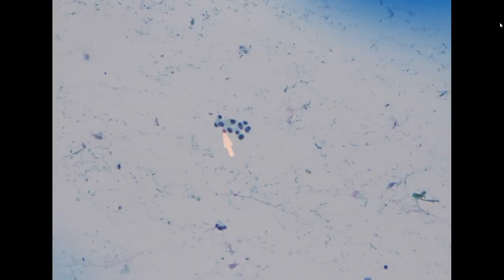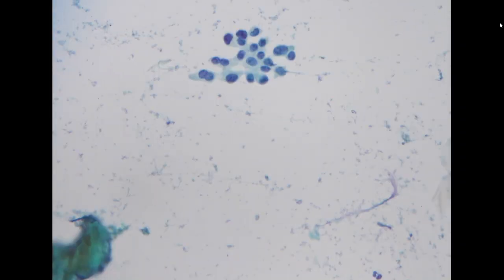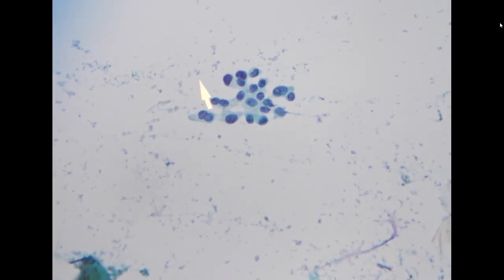So here again, we have hyperchromatic cells in a ductal arrangement. Here as well, ductal arrangement. And because this is not from primary breast, we won't be able to see the so-called myoepithelial cells because probably there are none, suggesting that it is likely an invasive cancer, a recurrent ductal carcinoma from the operation scar. So this is positive for carcinoma.